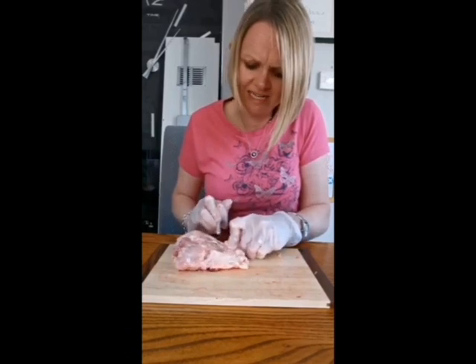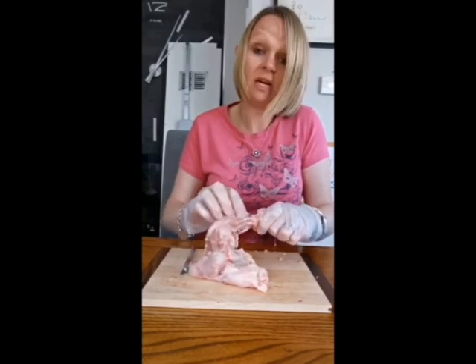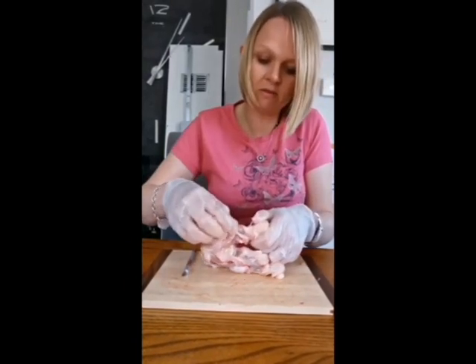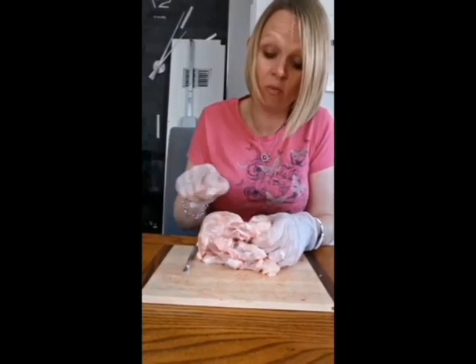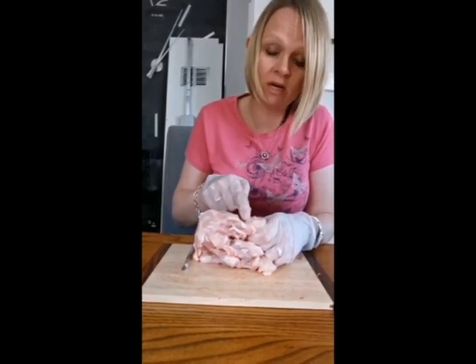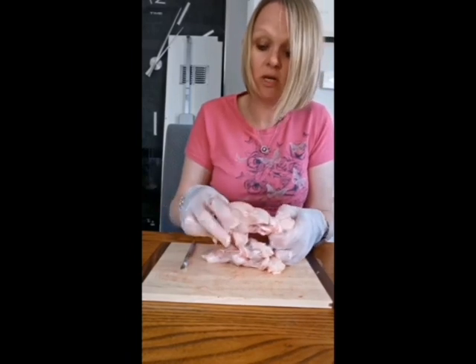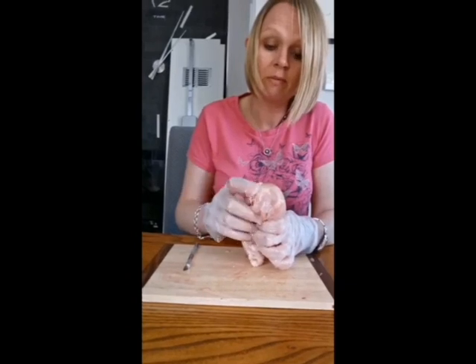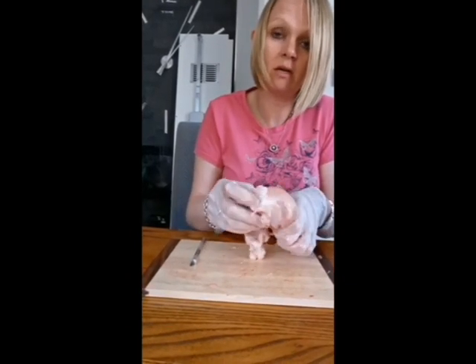It's very tricky to do these kinds of dissections at home. Obviously I haven't got my dissection kit from school. And there we go. That part of the muscle is now disconnected from the foot, which would make it all but near impossible for this chicken to walk anymore. So that bit that I just cut was the tendon, and it attached the muscle to the bone. So I'm just going to open up this bit a bit more now so we can see the bone structures, because where the two bones meet, we should be able to see the ligament and the cartilage.